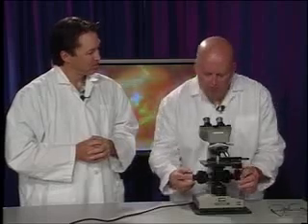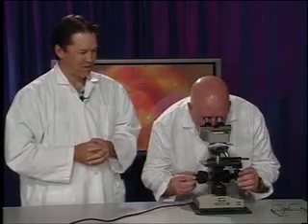Oh, yeah. I get you. So I hold fine focus here, move things up or down. Exactly. There we go. So I can move up and down, and I focus on different, what did you call them, layers? Yeah, there'll be different layers there, or different planes of view.